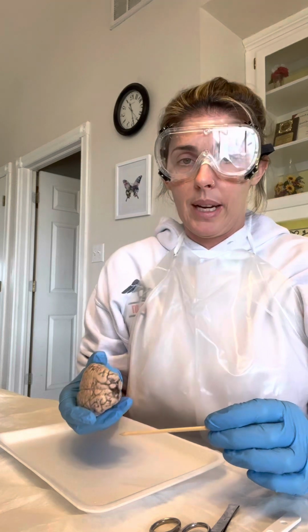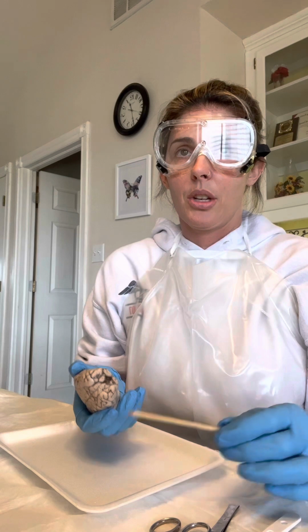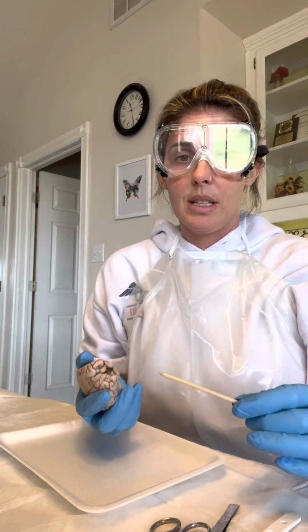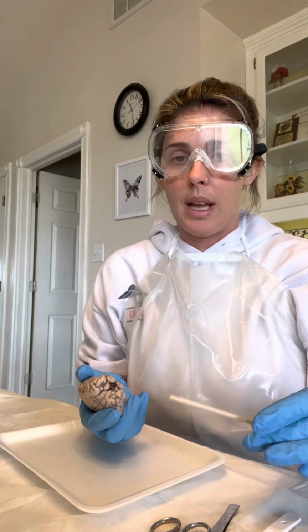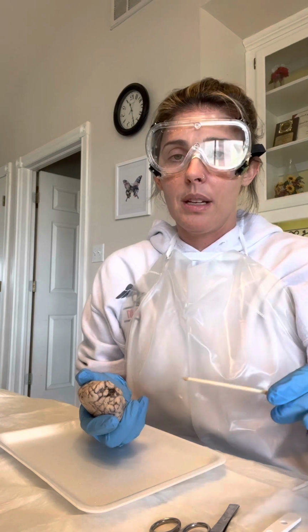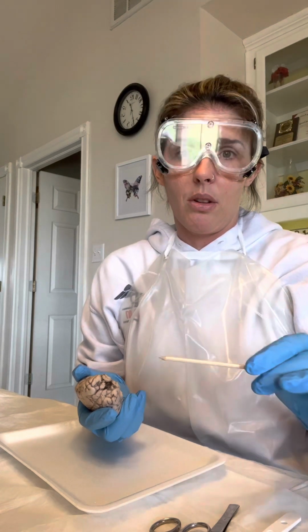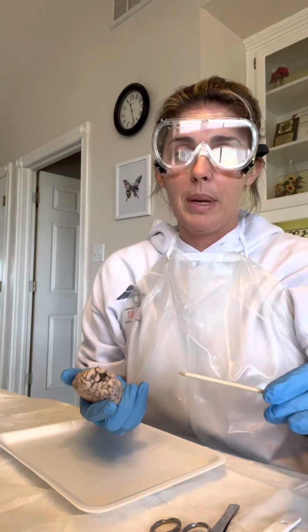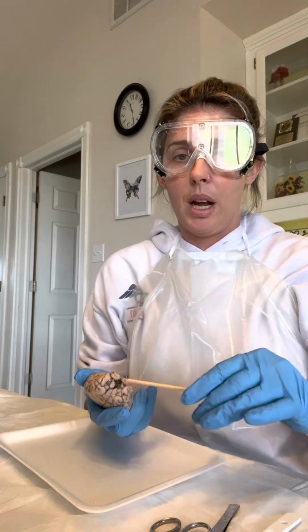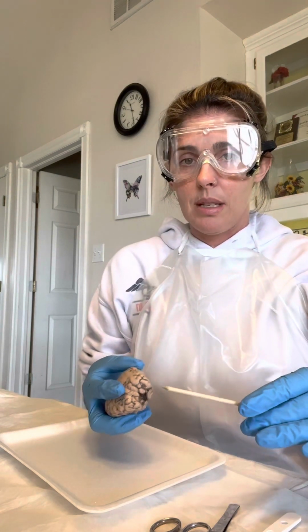If we take a look at the brain, in humans, we have a cushion around our brain. First, it's the meninges layer. We have a dura mater, which is the outermost layer, and then there is an arachnoid layer, which is the middlemost layer. This layer has all the blood vessels in it. And then we have a pia layer, or pia mater, that is the innermost layer which lines the brain. It helps cushion and protect the brain. Again, these are the meninges.